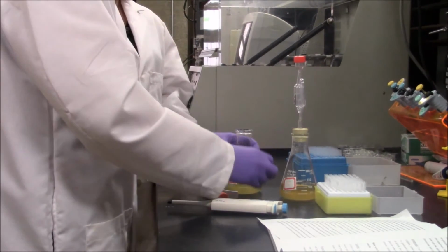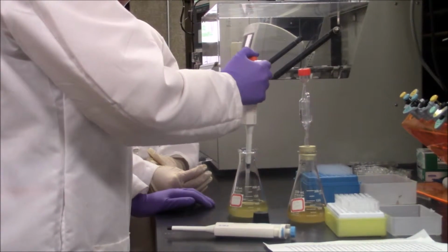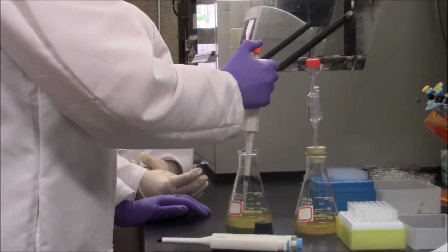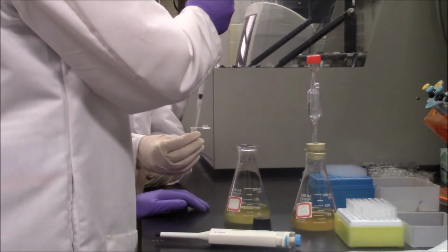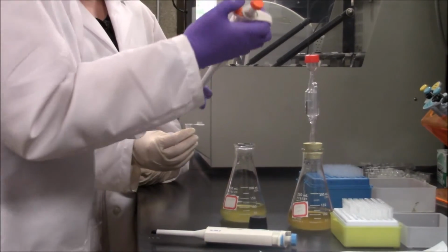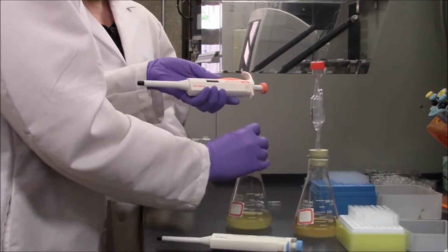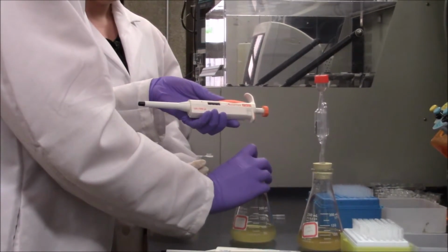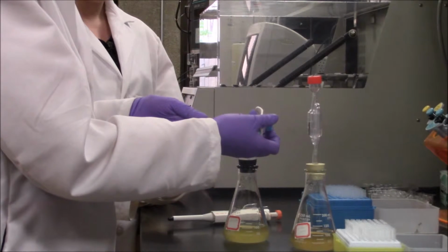At the start of the experiment, take a sample from the fermentation flask to test for glucose using the glucose meter and test strips. The sample should be diluted using the following ratio: 960 microliters buffer solution per 40 microliters fermentation solution. Use a small plastic centrifuge tube for this dilution. The initial solution has such a high concentration of glucose, 50 grams per liter, that it must be diluted to achieve an accurate reading by the blood glucose meters.